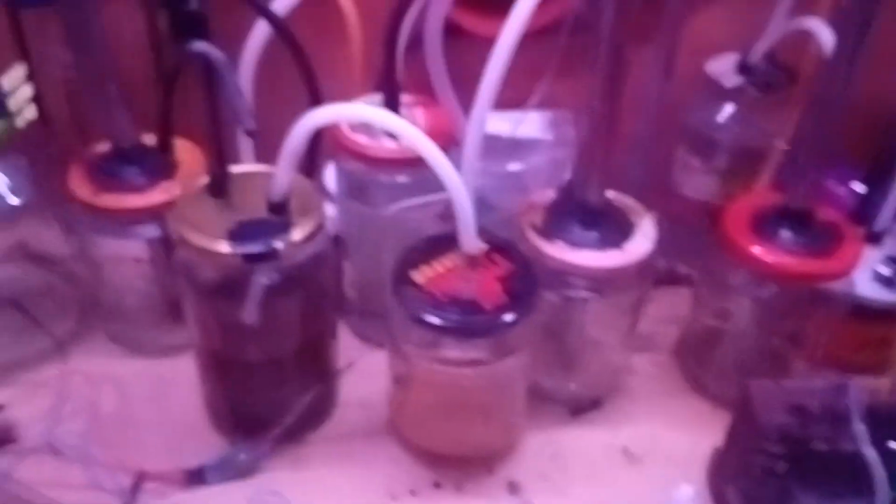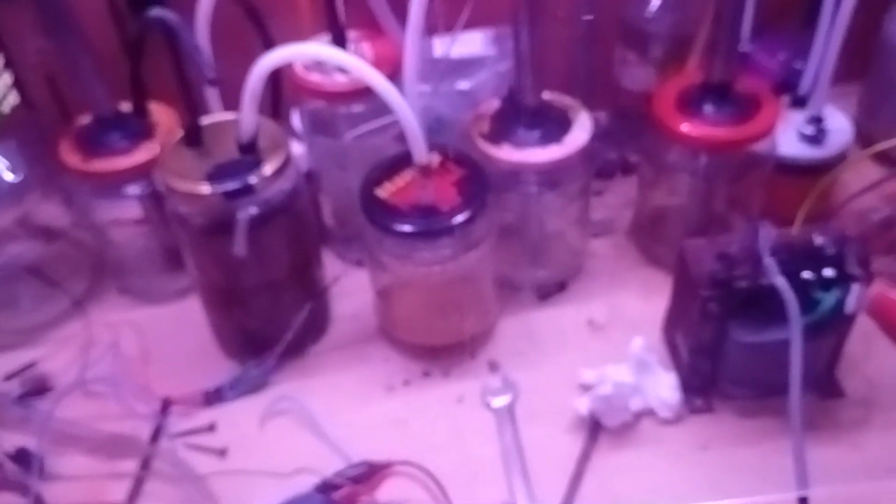I have shut down the system because we are not working. The jar is not hot at all, so it is definitely not burning anything. Yeah, disconnected the system. We'll have to come back later, or I think tomorrow, because there won't be that much time left. We'll see. I'm going to wait for the needle valve to print, then we'll come back.